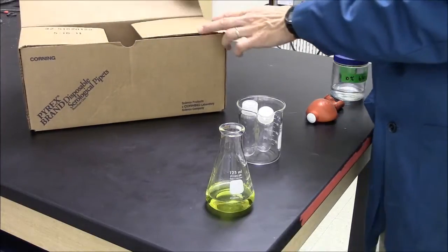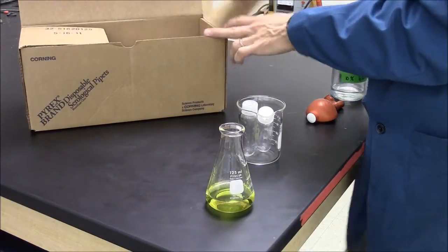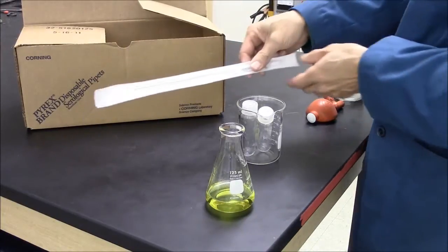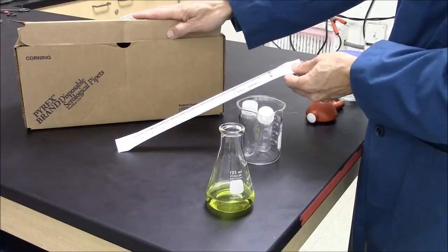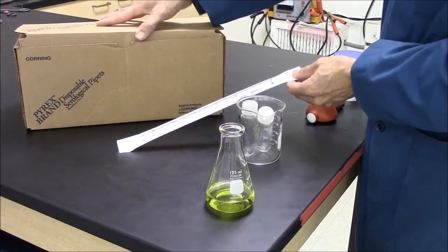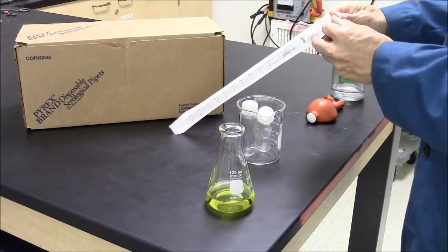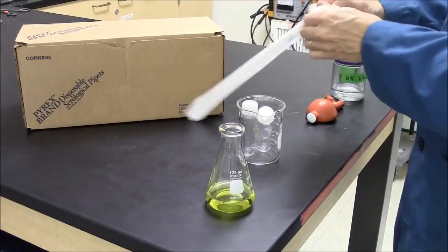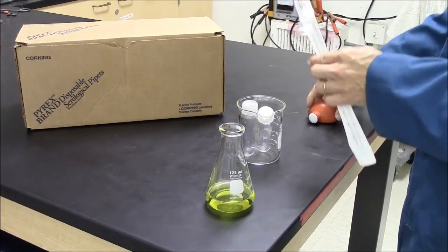Your instructions tell you to use a disposable serological pipette. They look like this. You have some in your standard issue cabinet already. You need to open the package. Try not to touch anything. They are sterile.